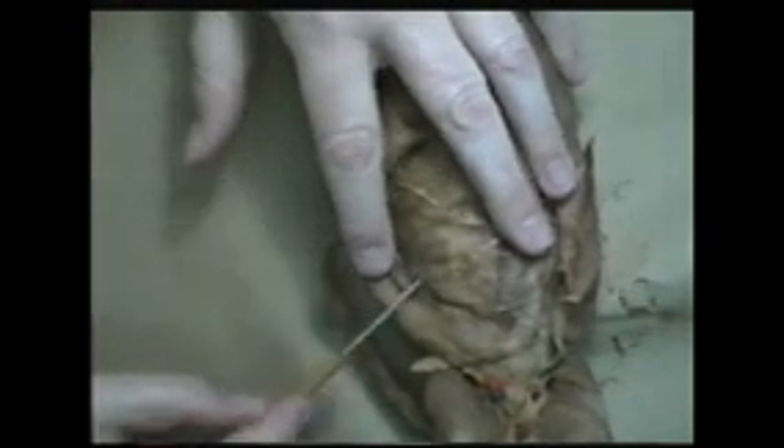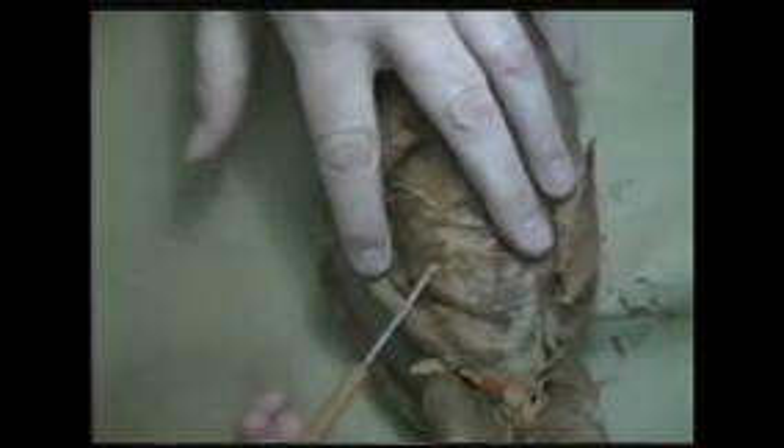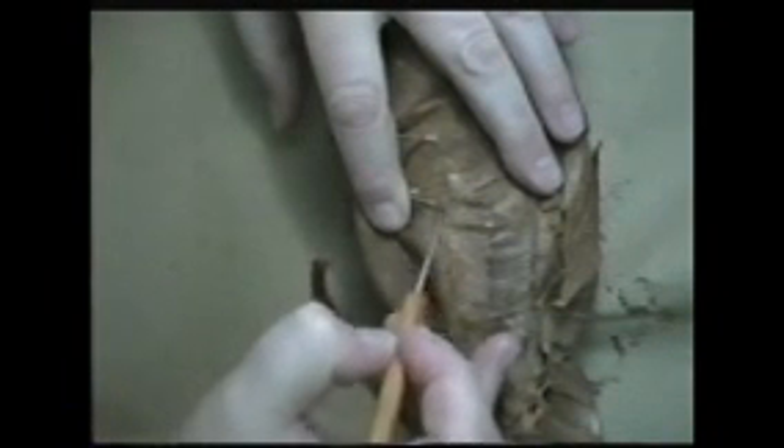Gently, to get these loose, I just kind of teased at the edge of the rectus abdominis muscle and pulled that back. Underneath there, I've got two other muscles that we have to know. The one immediately underneath, with fibers also running at a slant but this time running upwards, ending in a little feather edge right about here — those are called the internal abdominal obliques. Where they end, another set of muscles, which are actually passing underneath them, kind of cross over to the rectus abdominis, and those are called the transverse abdominals. You can see their fibers up here above a little bit right there.